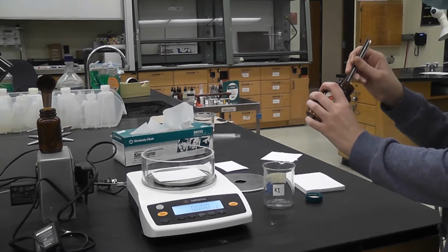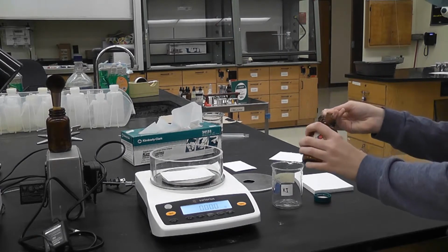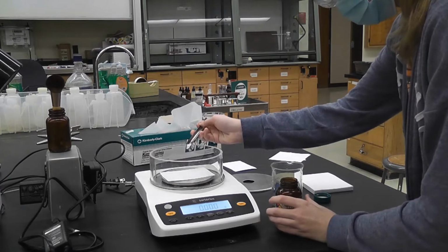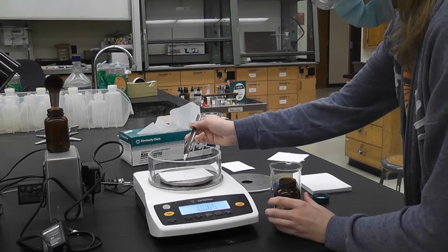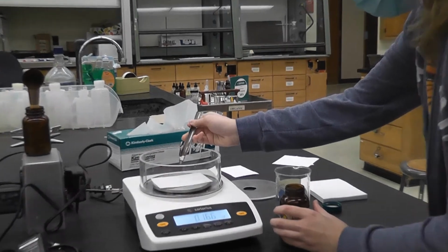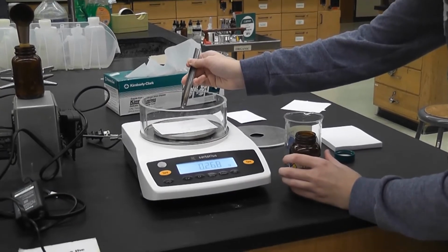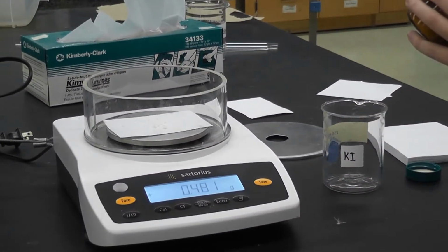It's going to be quite a bit. These are more of crystals. Oh, we're close.